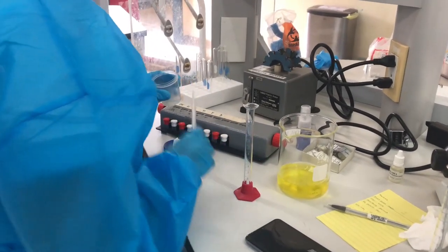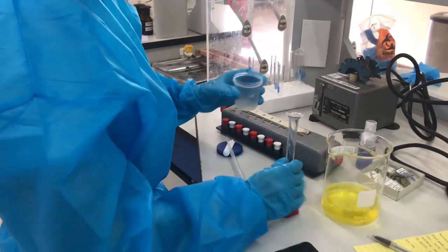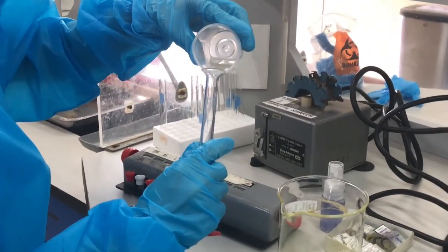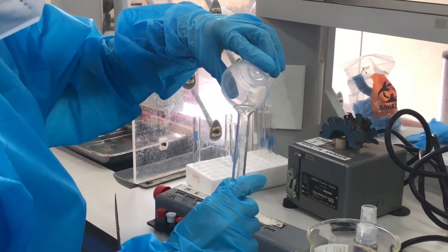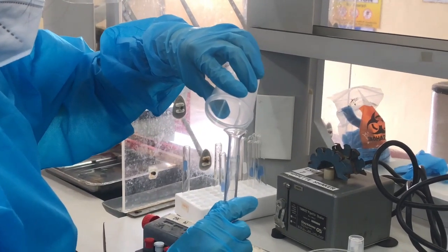Hello everyone! For this video, I will be performing semenalysis. This determines the number and quality of sperm in the semen sample. To do this, first we have to do macroscopic examination, and what I am currently doing is measuring the volume of the specimen.